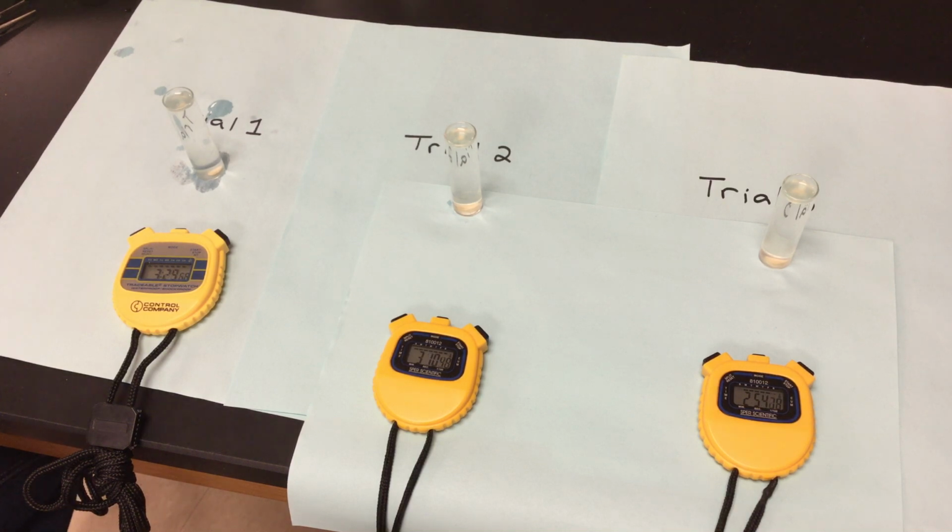We're still going to give the first one another 30 seconds. This one's got about another 45. Last one's got about another minute before we cut it there. So we said 4-minute maximum was our time. So we're about 3:45 on the first one. Really haven't seen too much movement whatsoever on it. No bobbing up and down, no kind of floating halfway. I don't really see too many oxygen bubbles being produced. There is hydrogen peroxide in this solution, but what's going on with the pH of 11 that's affecting this reaction?